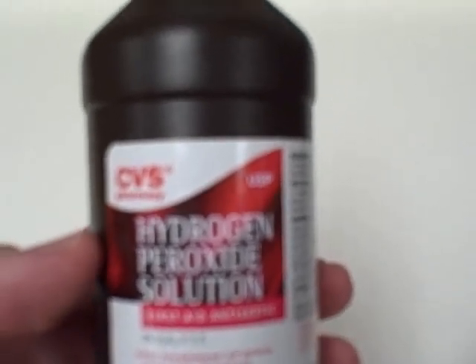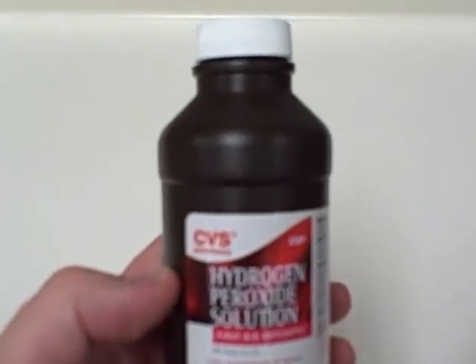Have you ever wondered why hydrogen peroxide comes in a dark bottle and why it has an expiration date?